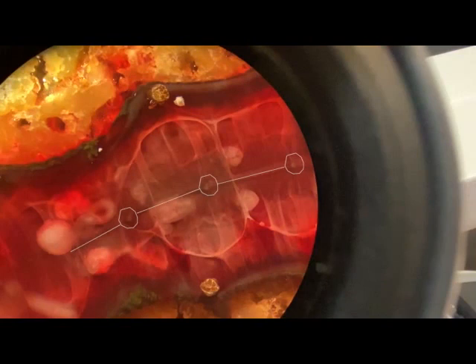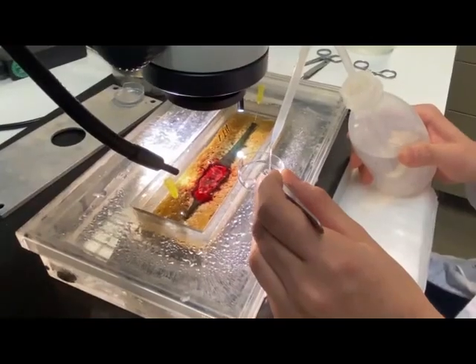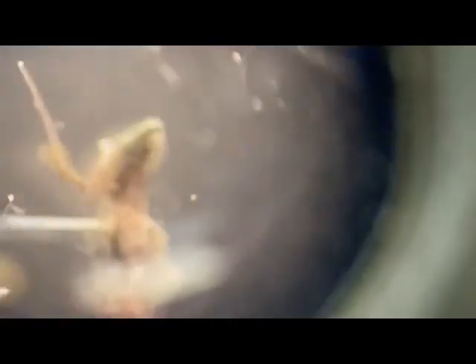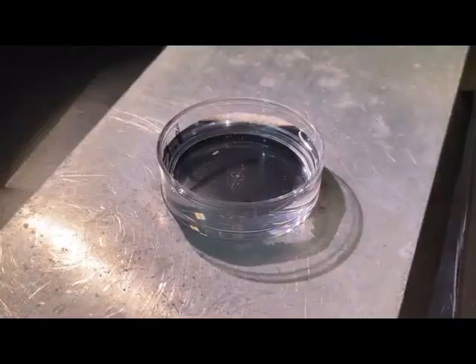All of the 32 body segments of the leech contain a ganglion. All ganglia are connected to their anterior and posterior neighbors. For our experiment we isolate a single ganglion. Now we need to pin the ganglion with their stomach up on the silicon elastomer, which is covered in the petri dish. Ta-da!